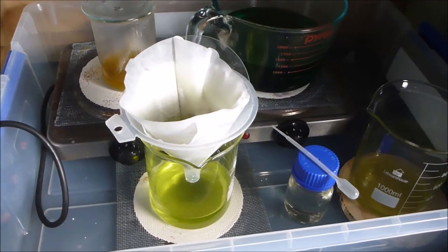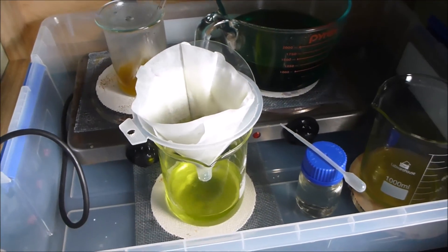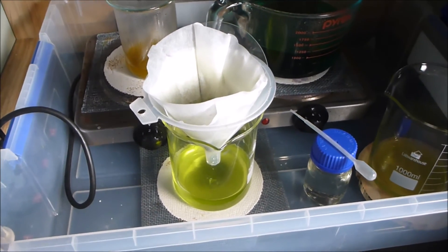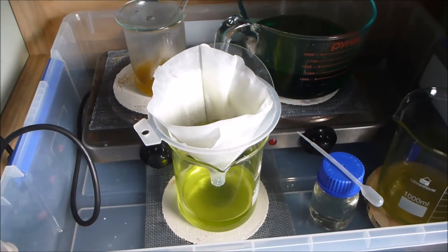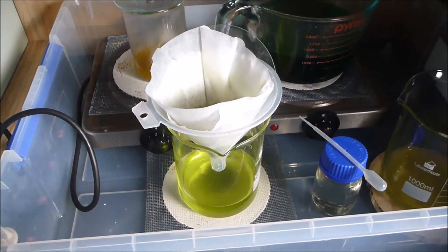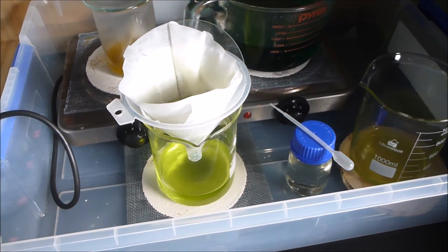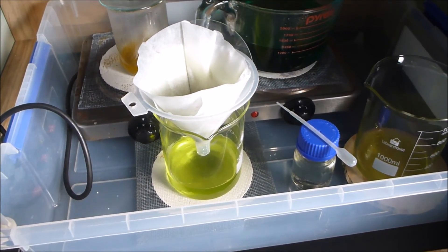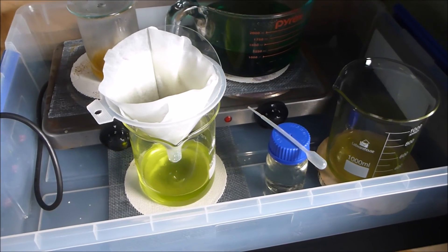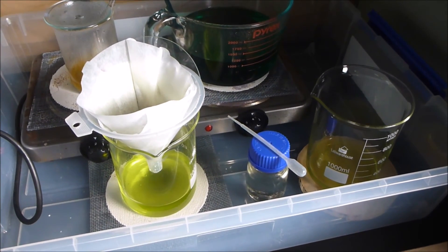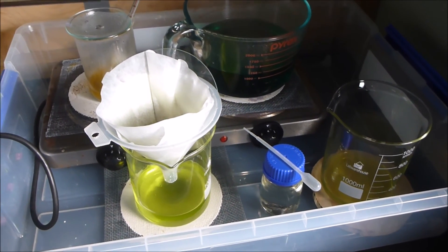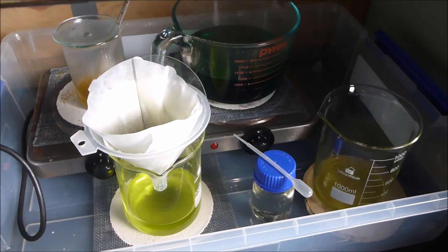Another thing that's a really good idea before you bother to do any of this is to cool that solution, because cold solutions will hold fewer salts in solution. So you might as well filter the salts out while you're busy doing this. That's my little tip of the day - hopefully that was useful to someone. That's how I clear up my AR solutions to make sure they are crystal clear before I precipitate the gold.